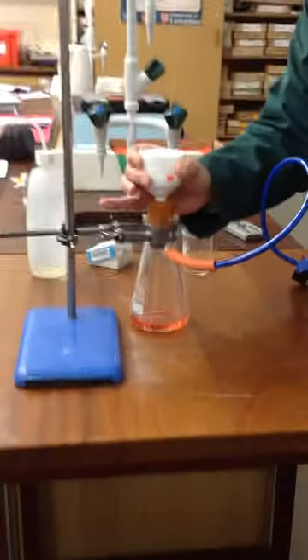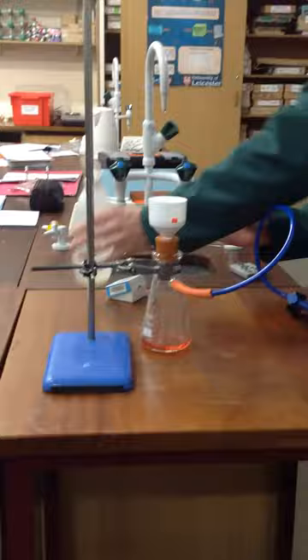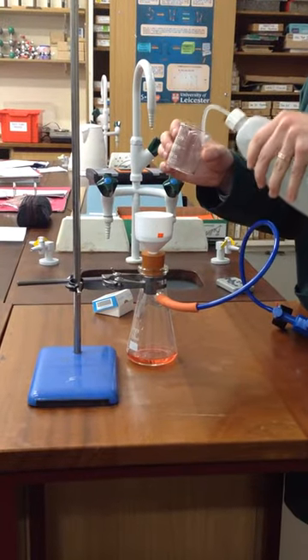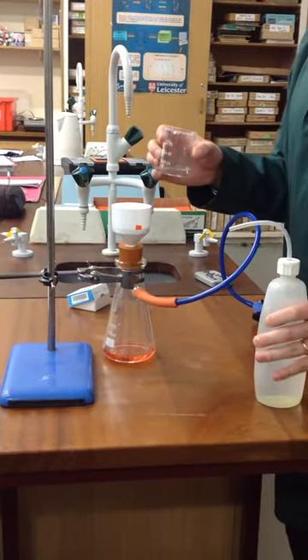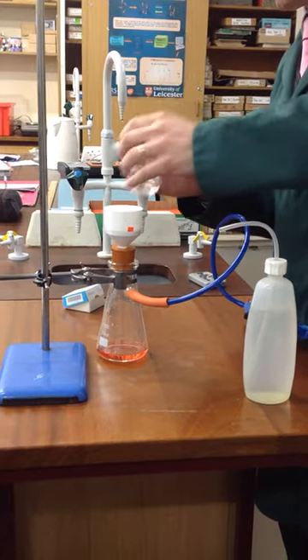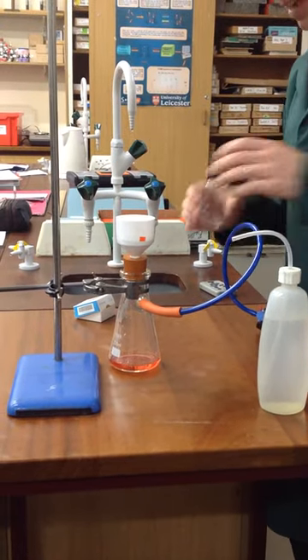Okay, so that's gone through. Now a good idea just to rinse this, so if we take inside of the beaker here, just to get any solid out, and go through again.